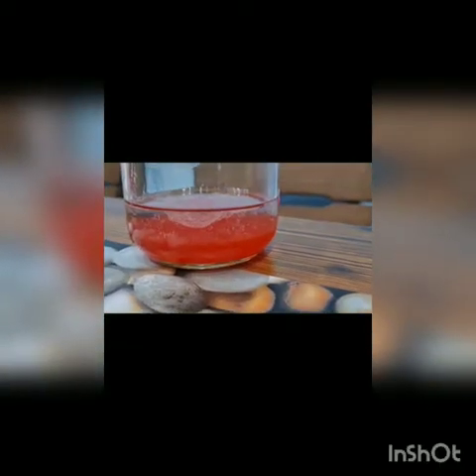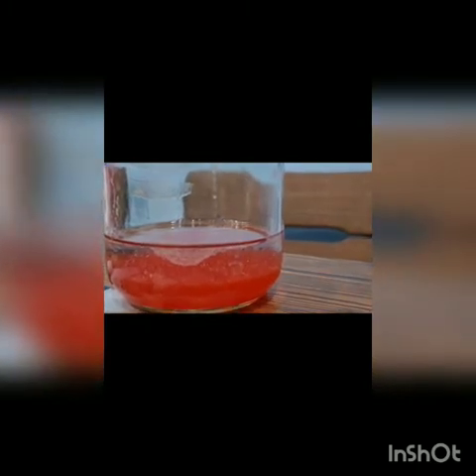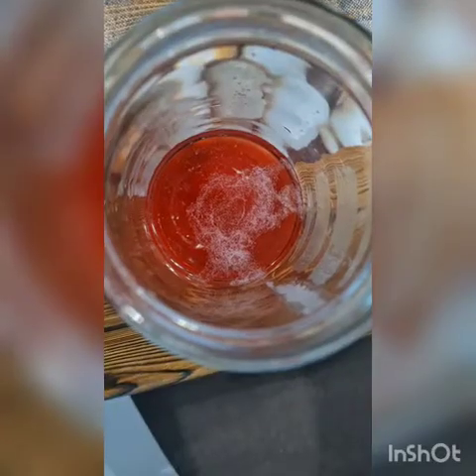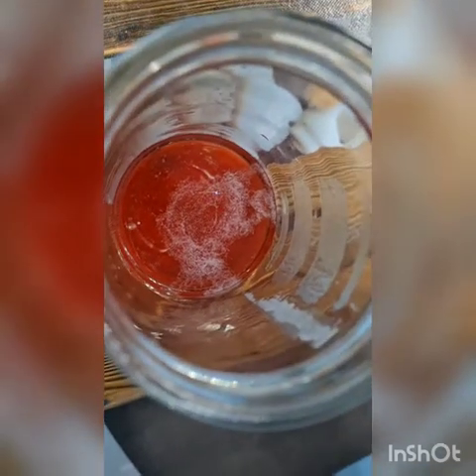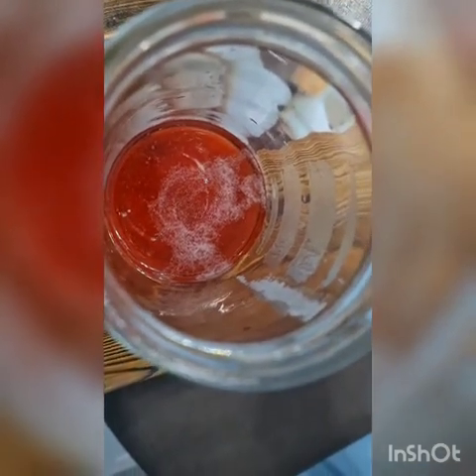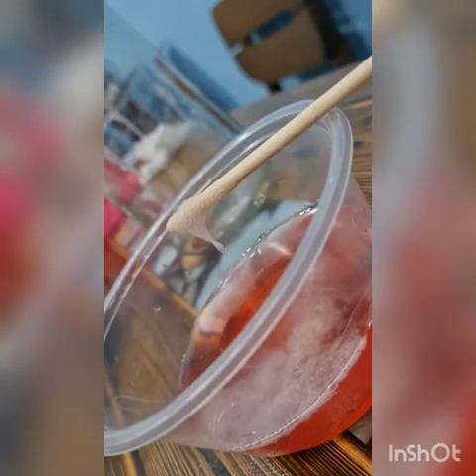After the alcohol is added into the mixture, we can see that there is a separation between the alcohol and also the mixture, and then the DNA start to form on top of the mixture. So as you can see, the snot-like thing, which is clear in color, that is the DNA of the strawberry.